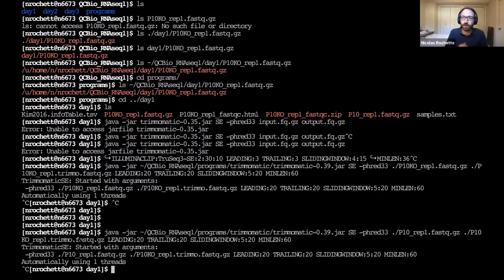Just because I edited things by hand, right? So this is just one sort of human error you can make, and I've pre-made some human errors like this. And then you probably would realize later on in the pipeline that two samples are strangely identical, with the exact same number of reads, exact same gene expression, which is just not possible, and you'd have to go back all the way and redo everything. So it's better if we don't run into these problems.